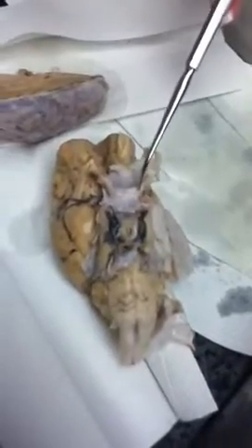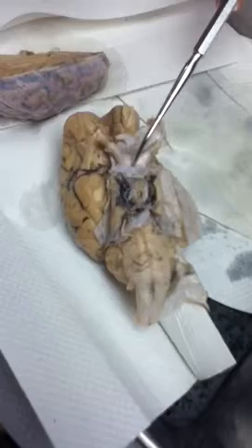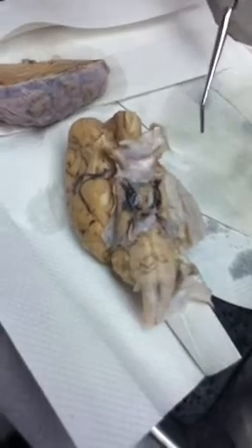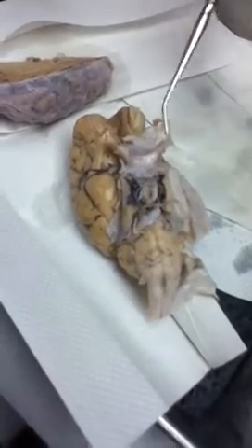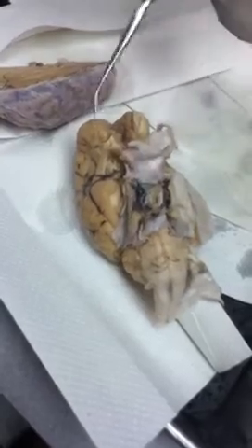Okay? Now we're going to turn this over. Olfactory bulbs, right beneath the frontal lobe. Optic nerves, where the optic nerves meet in the center, is the optic chiasma. And then leading to the back of the brain from the optic chiasma are optic tracts. Right in the center here is the pituitary gland. On the sides here are your trigeminal nerves.